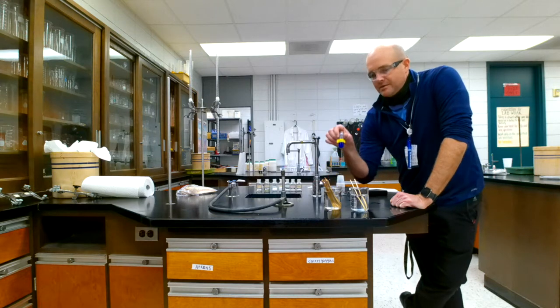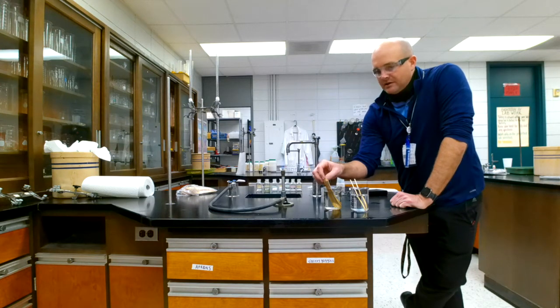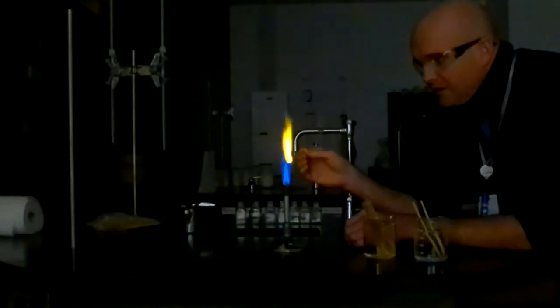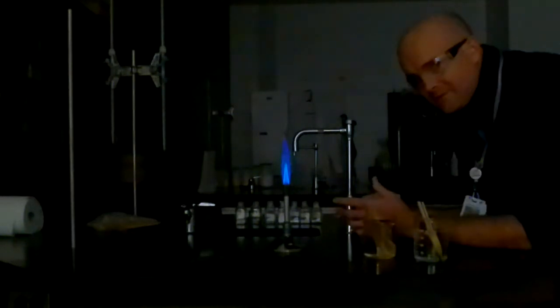So here is copper nitrate. Now, unfortunately, it absorbs a lot of water from the air, so it looks like a liquid. But it'll still work. So I turned out the lights. You may not be able to see very well, but I can still see. We have copper nitrate, and so as we place it into the flame, we get that color. All right. Now, as the liquid burns away, you'll see that the splint has the same color as what it was before. So that yellow color at the end was the splint. But what color was that? That looked green to me.